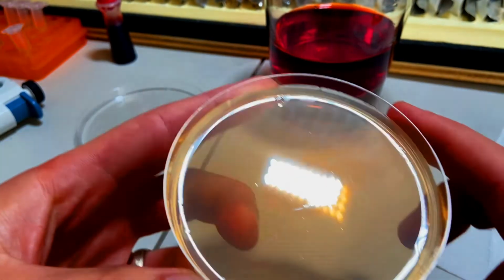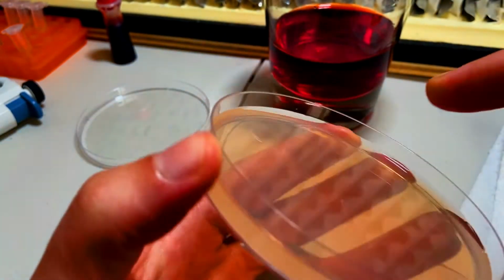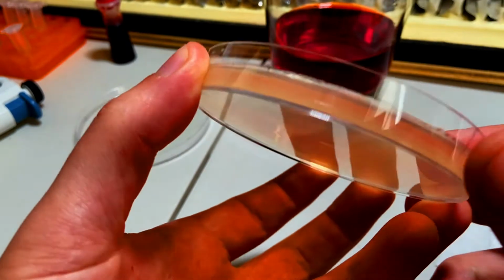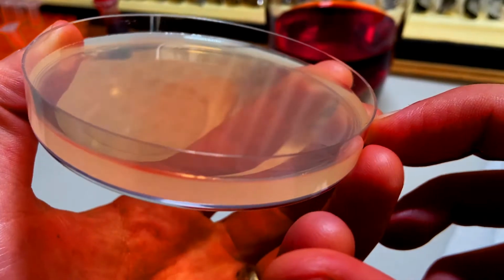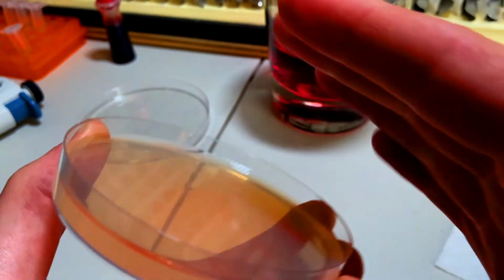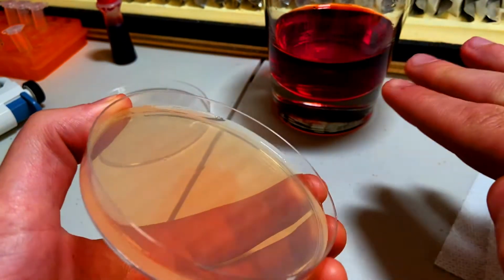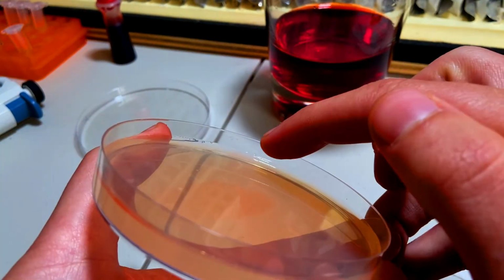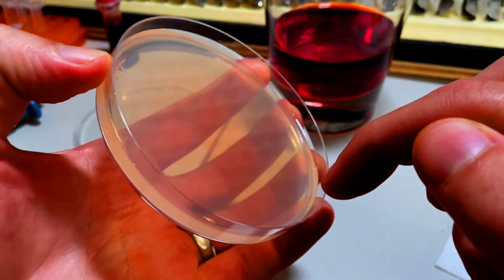I can tell you already too, just by doing the spread, that not all of it has gotten around these edges. For whatever reason, oh, here's another interesting take. For whatever reason, whenever I poured these, I noticed that a little bit of the media is kind of concave. And as a result, it's a little bit harder to get the spread, whatever it is you're spreading, up around these edges here.